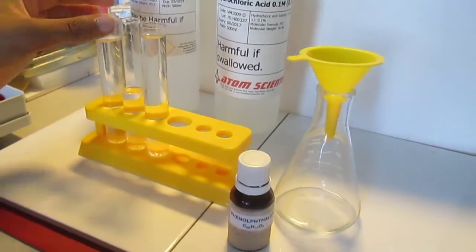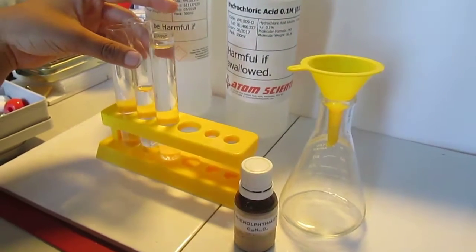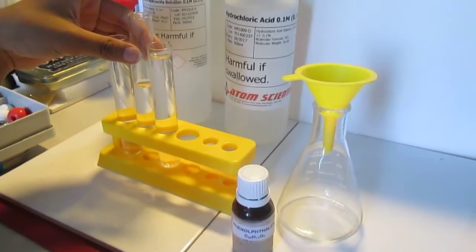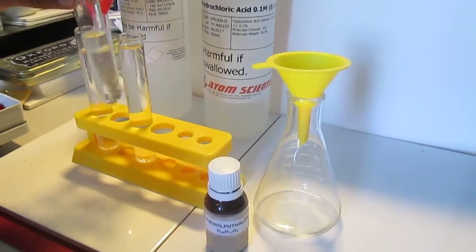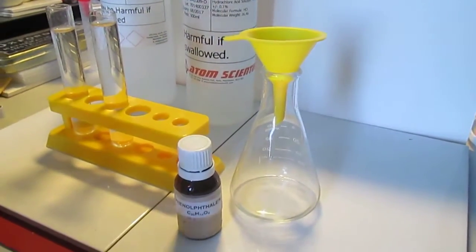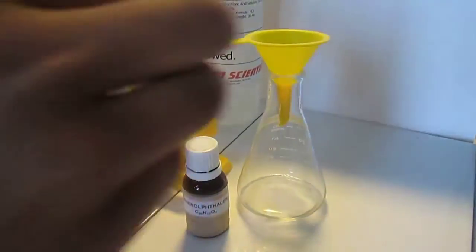You first pour the sodium hydroxide into a chemical flask. You can see that it is a clear colourless solution.